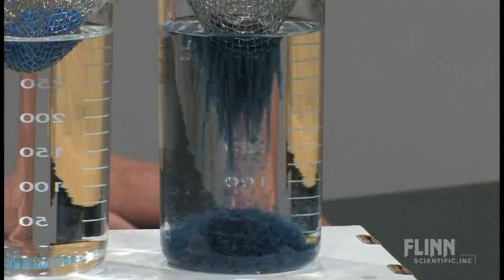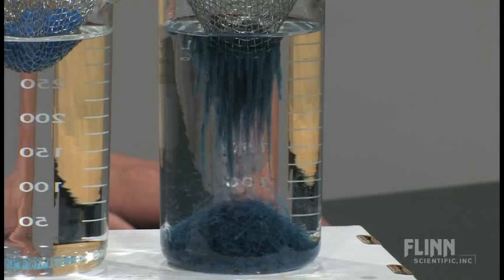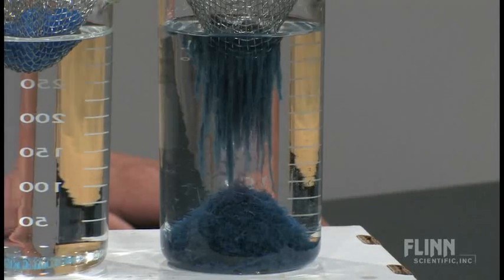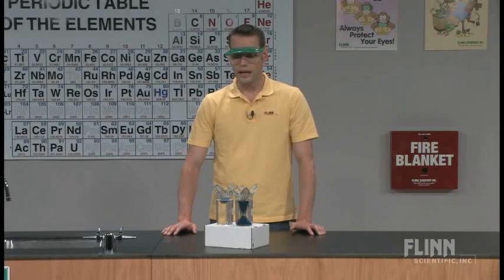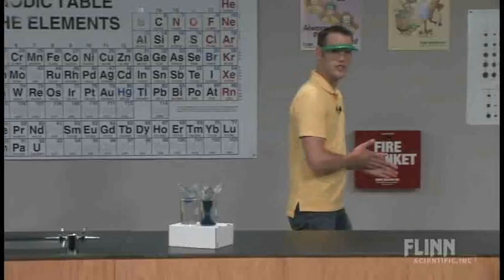You are generating cobalt hydroxide, but sometimes it only adds in a piecewise fashion. The cobalt hydroxide can form where one hydroxide replaces one of the nitrates, or it can go where both hydroxides replace the nitrates. So you get two different colors of compounds — one pink and one blue. I'm going to go to the chalkboard now to show you the reactions and what's actually happening here.